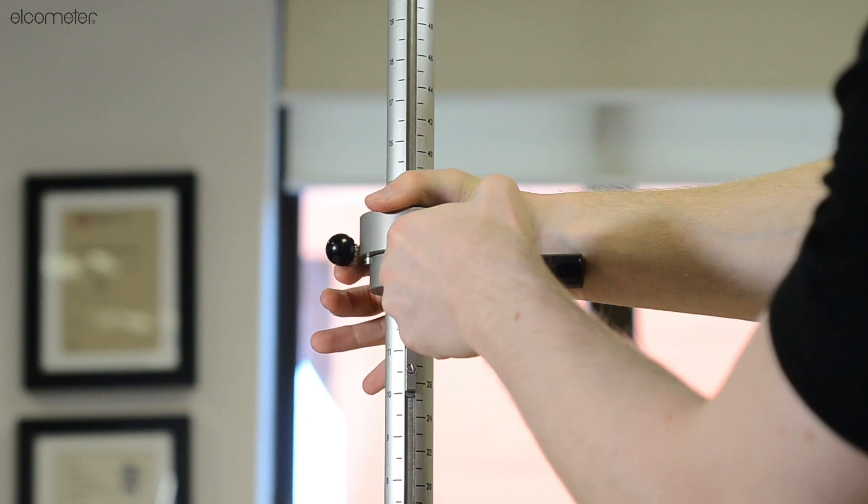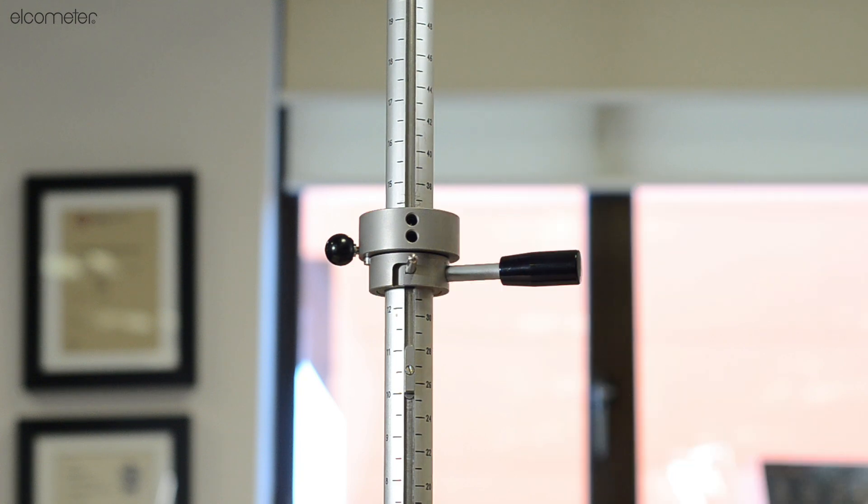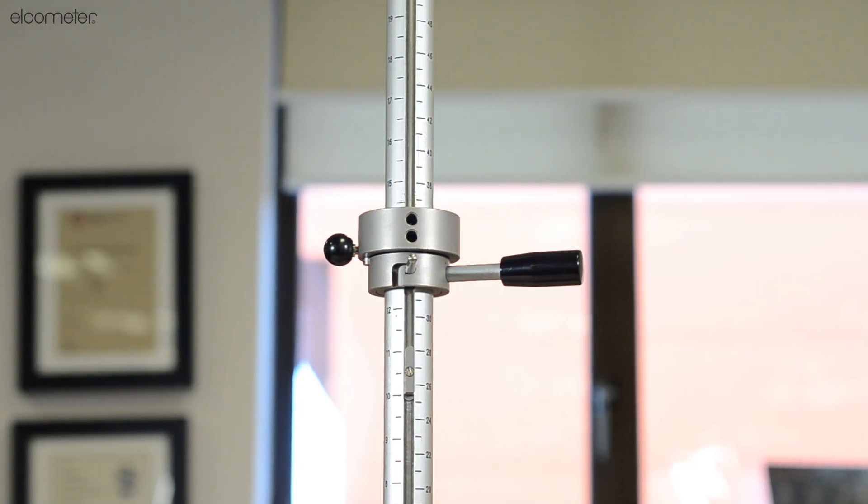Then lift the weight up to the release collar and lock it into position by rotating the handle on the release collar.